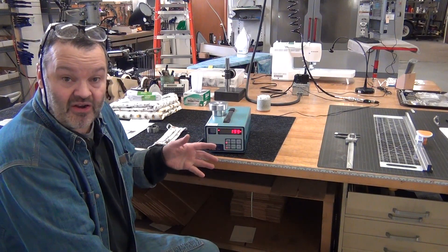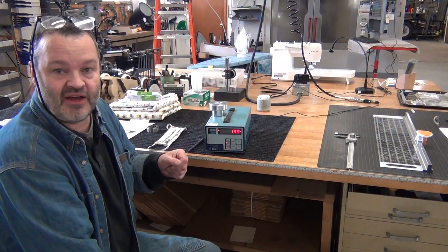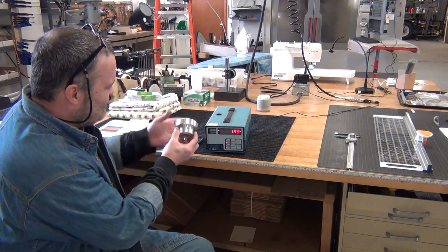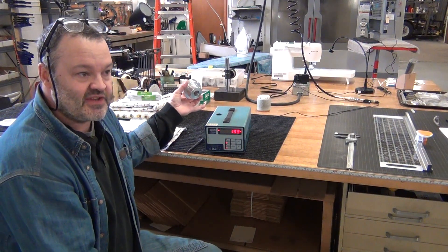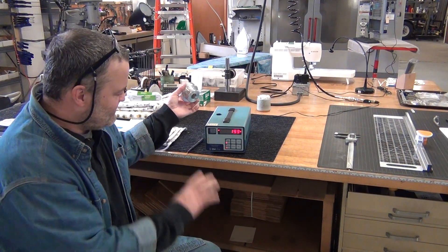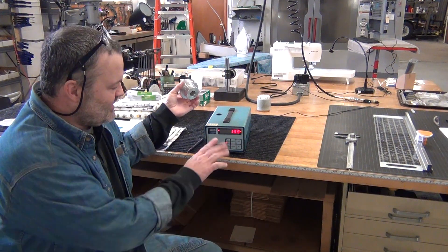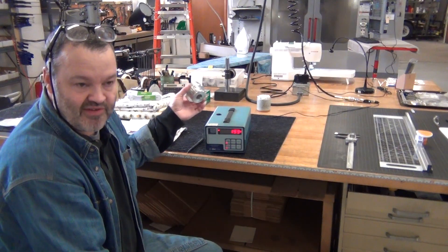I've got a couple of materials here we'll try. I'll show you how I'm measuring them with this. If you have materials that you think are abundant, easy to sew, and you'd like me to test, let me know. So what does this machine do? There's basically a quarter-inch hose barb inlet where it draws air in and there's a laser that counts each particle of dust. There are some filters and you can set it to measure at different particle sizes.